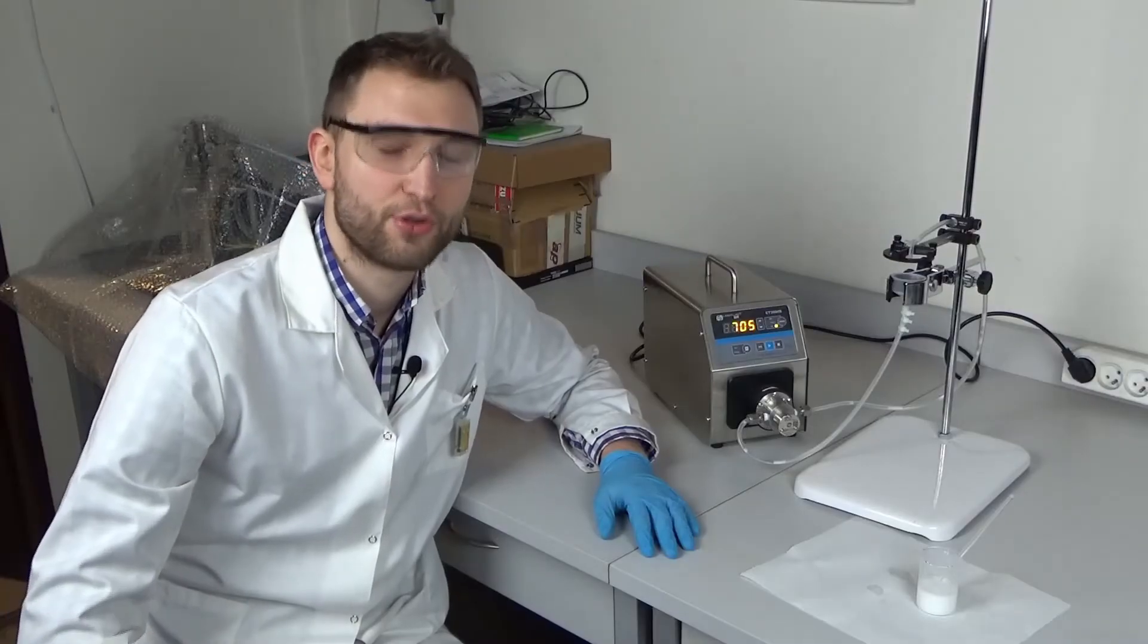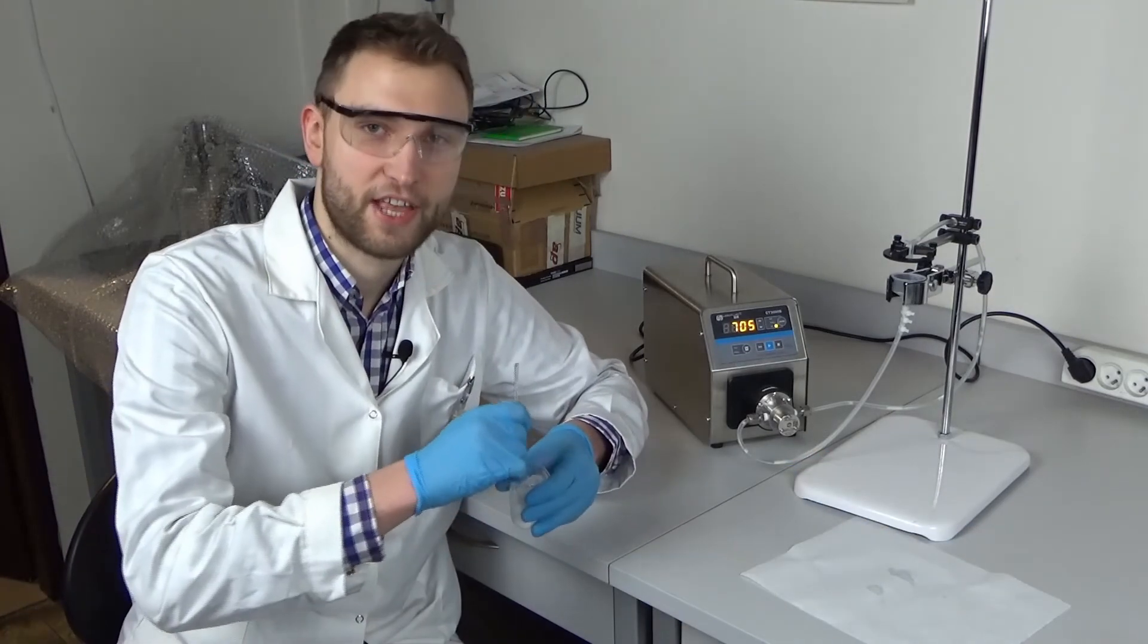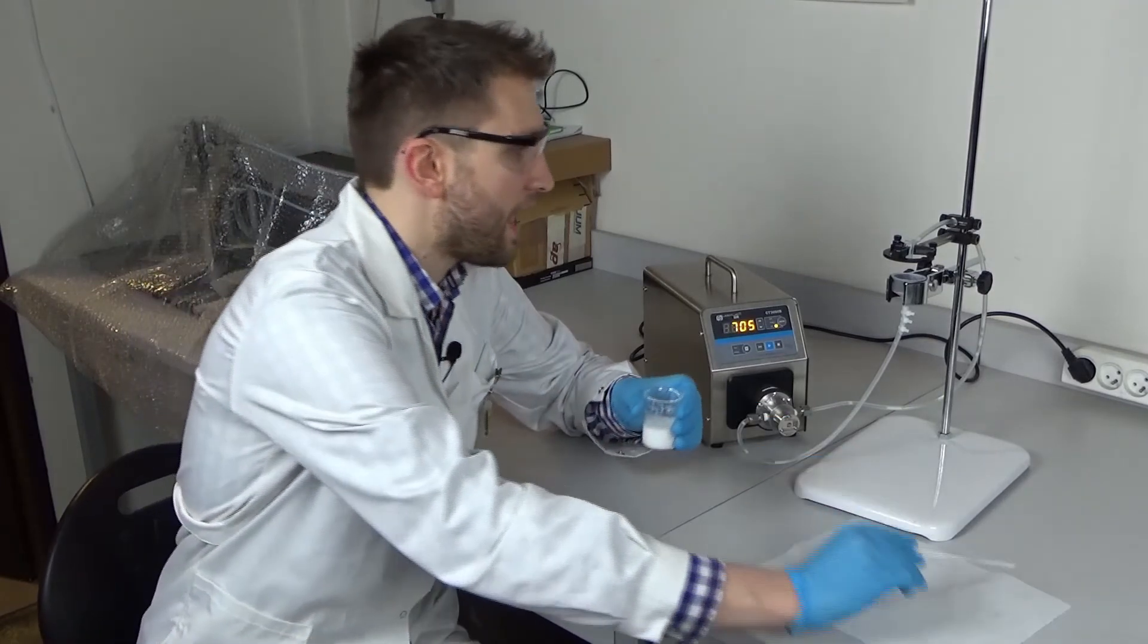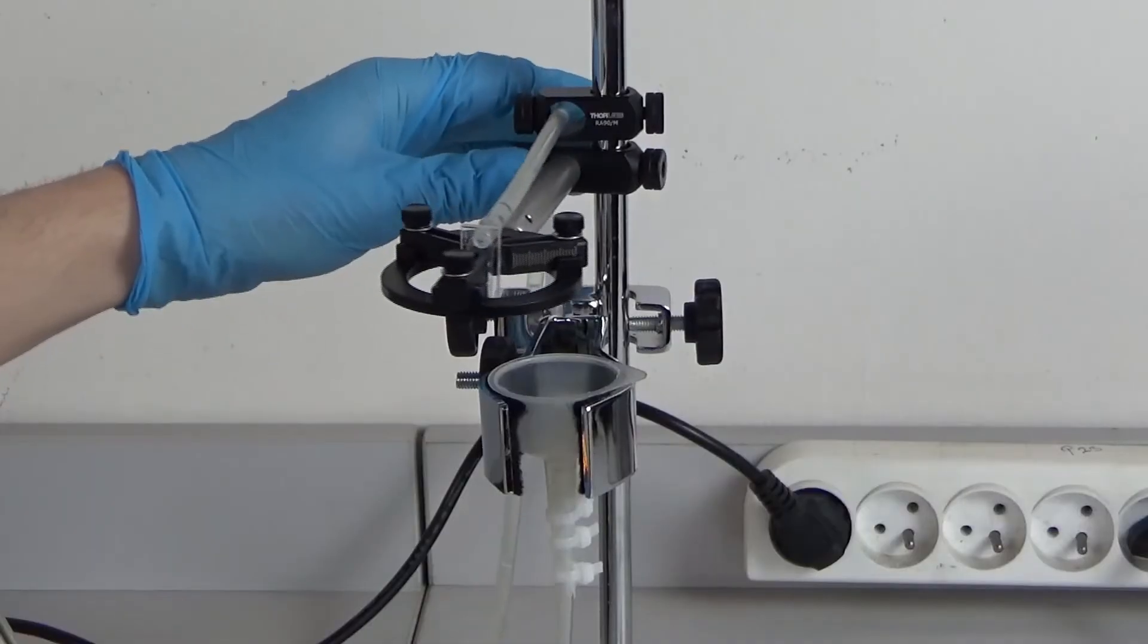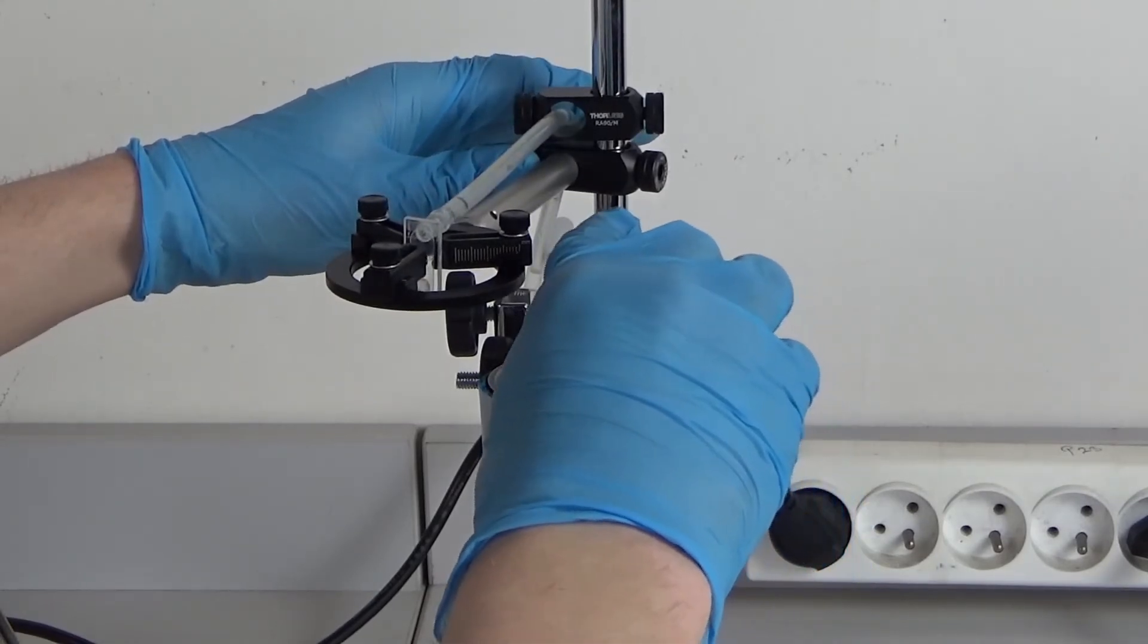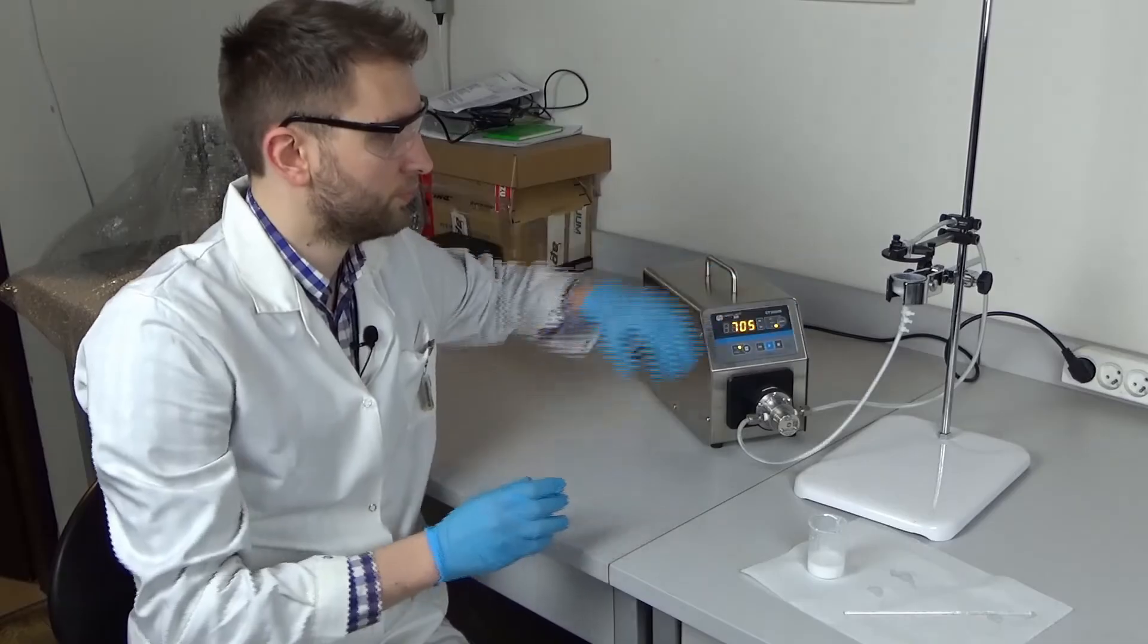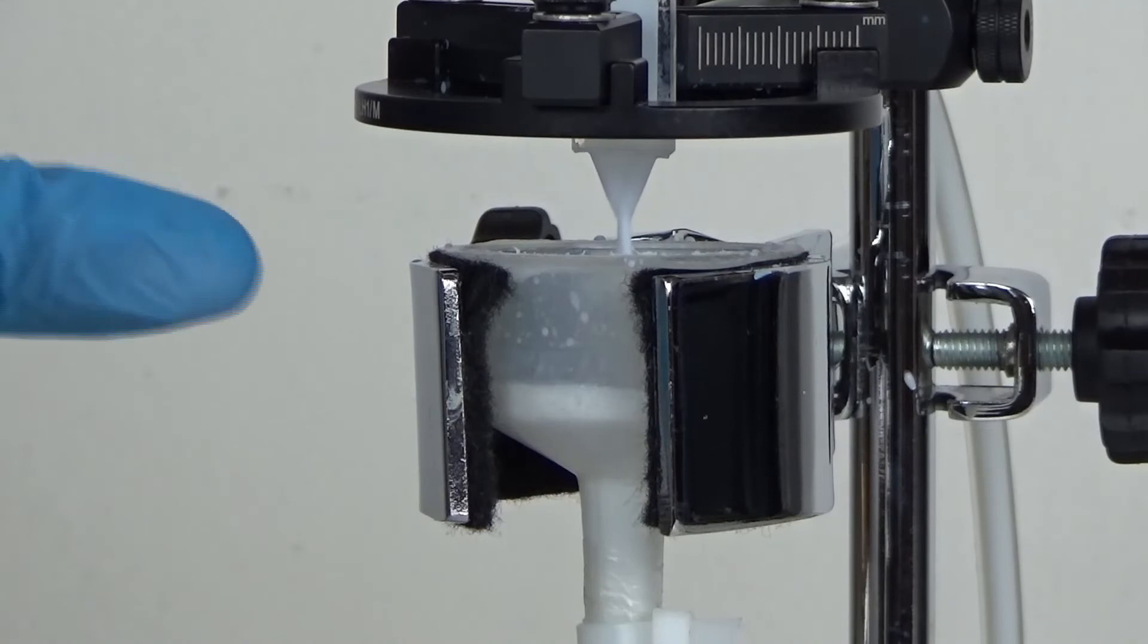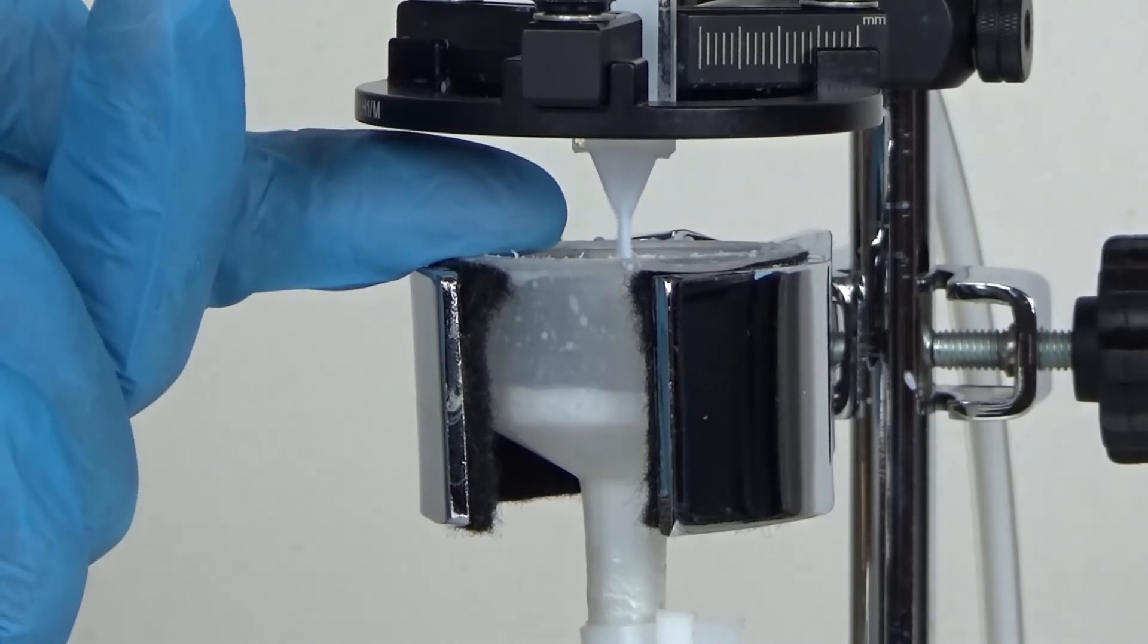We are almost ready to turn on the pump. We just need our sample. Let's give it a shake or two, and now I will fill the funnel with nanoparticle suspension.